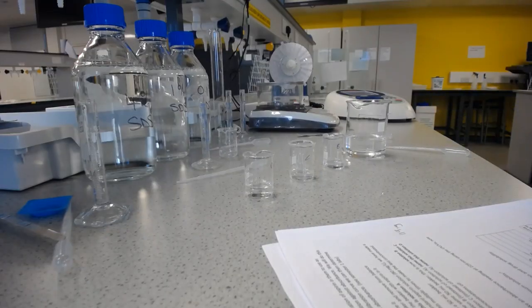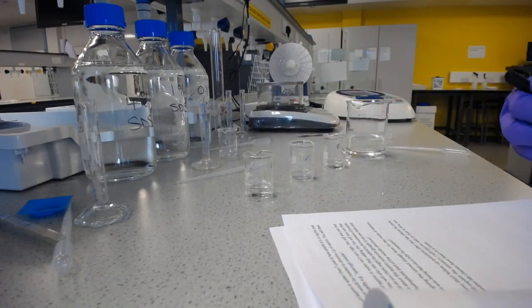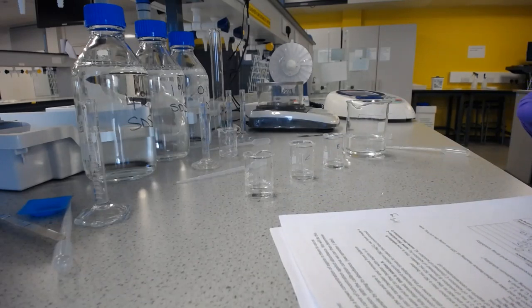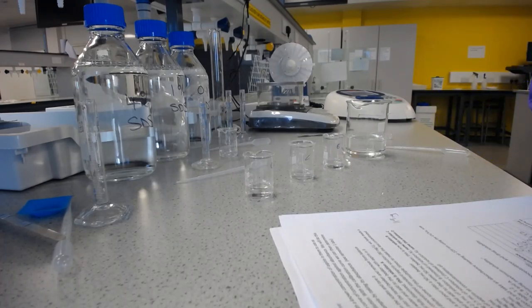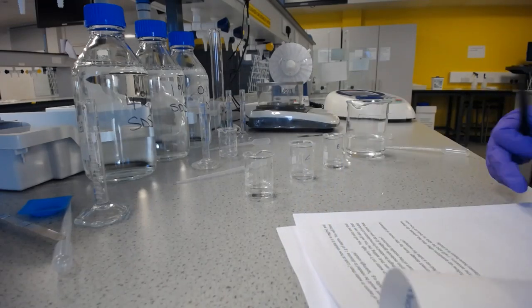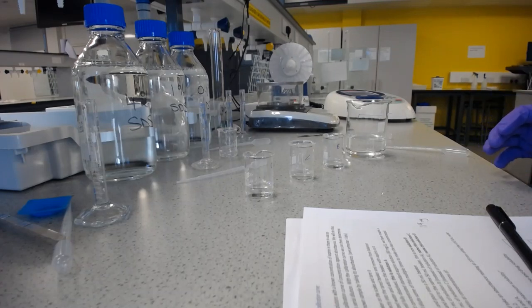So now we've got the results for our calibration curve. What you need to do is, as I said, there's a piece of graph paper in here, or you can do it on Excel, is plot the concentration along the bottom and the absorbance along the y-axis. So concentration on the x-axis, absorbance on the y-axis. And then with that you'll be able to determine concentration of our unknowns. So from here we can now move on to actually looking at what we're doing with saturated solutions, and once they're done we'll come back on and I'll go through that.